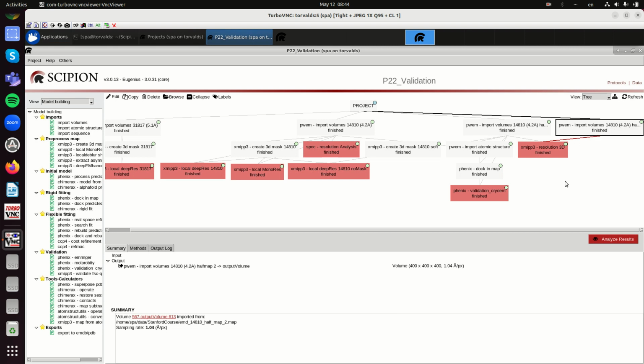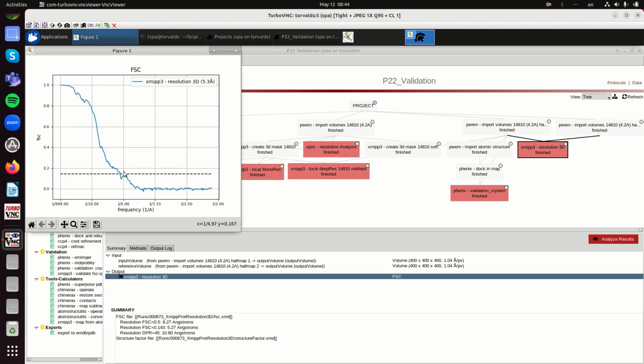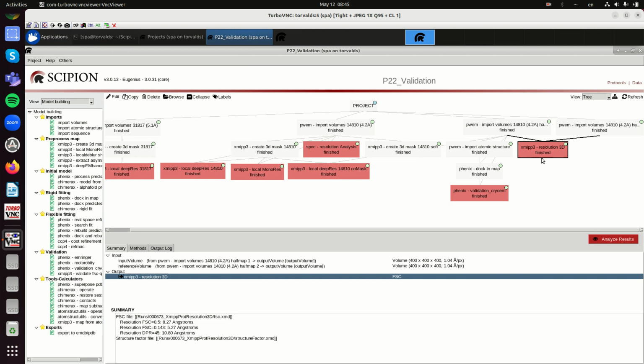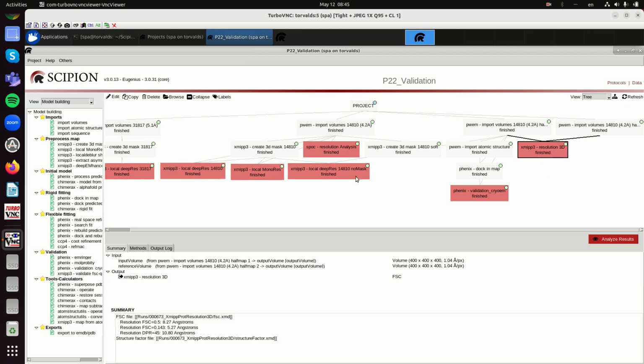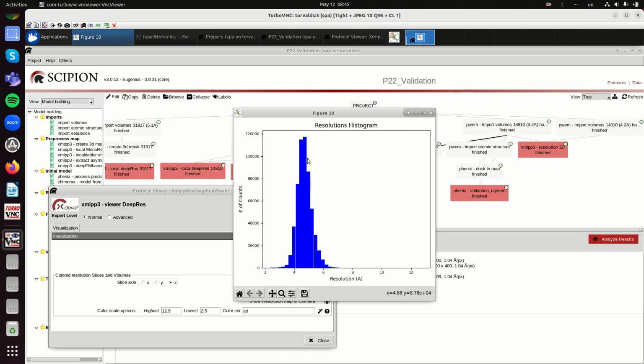So we can compare the resolution between these two, the FSC between these two. The FSC between these two is 5.3. So it seems that this claim of 4.2 is an overstatement of the underlying correlation. This is happening because of the masking: when you apply a mask to a structure, you're correlating the Fourier coefficients in Fourier space, and then they correlate much better. So it seems that it is a 5 point something angstrom, which is consistent with what we were seeing here of the local resolution. The local resolution identified it, but it needs the noise around, otherwise it cannot make a proper comparison.